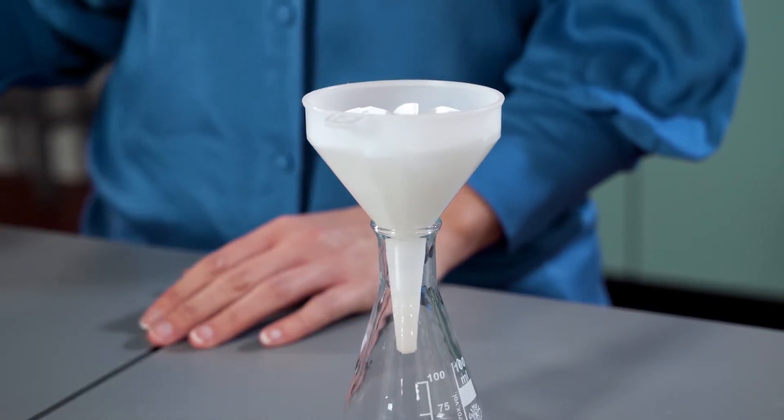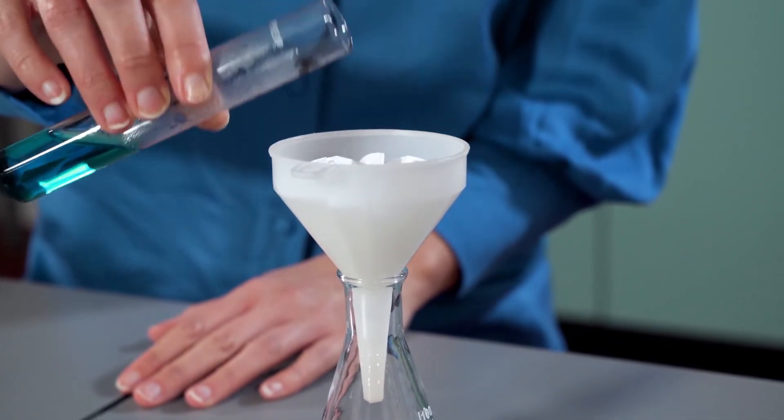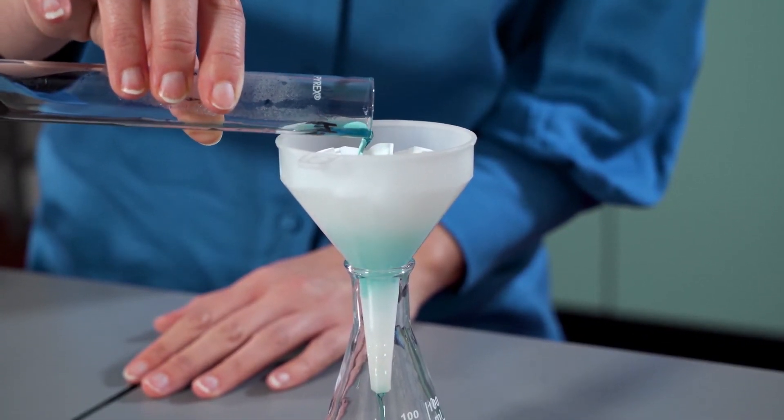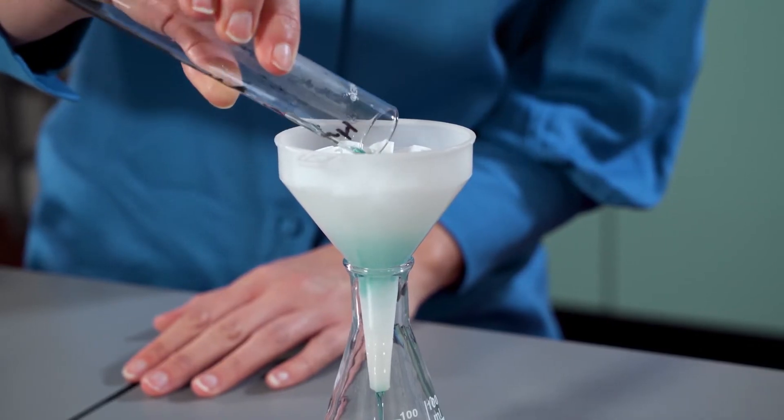Now I'm going to pour my copper sulfate into the filter paper. Be careful when pouring that none of the copper sulfate solution goes over the edge.